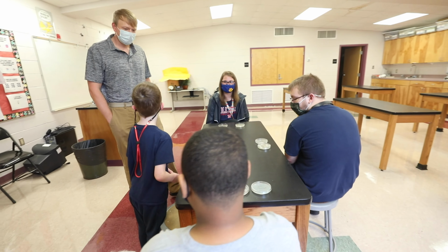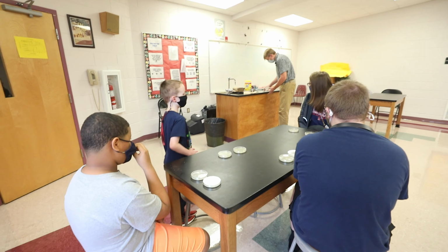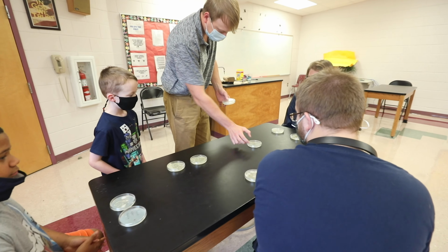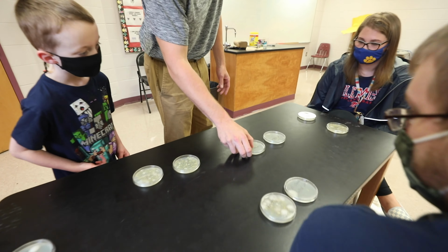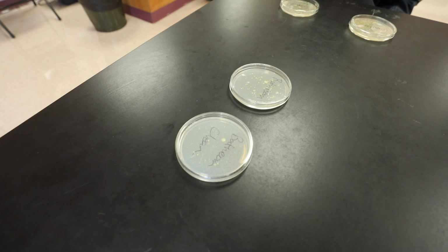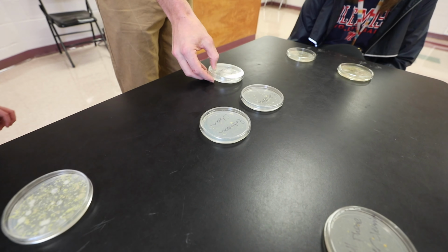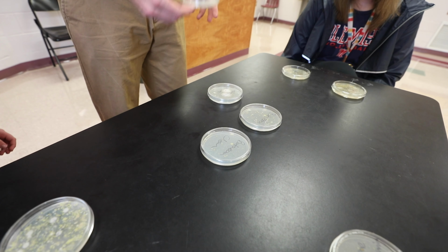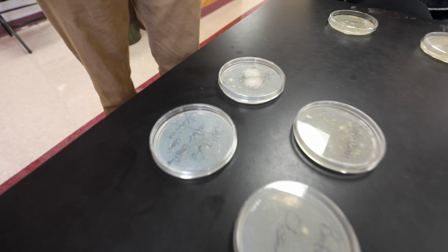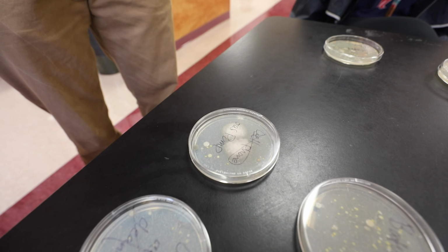We had two more also that y'all didn't go with us. This was a bathroom at one of the convenience stores. You see before, cleaned it, and after. Kind of the same thing. A lot less growth on this one. This was a gas pump, which everybody uses. We don't think about them a lot, but this was before I cleaned it, and this was after. So once again, you can see there's less growth on the one after we cleaned it. Wow.